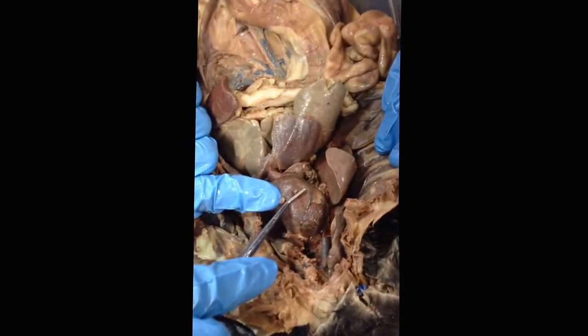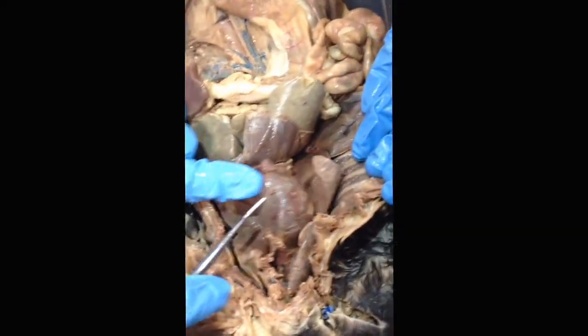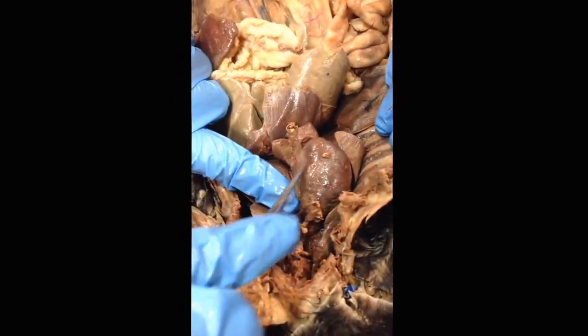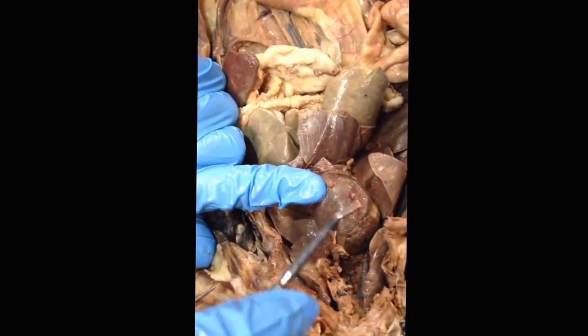Again, the best way I can give advice on this one is to look at from the perspective of the cat. So what Stephen has there is the left ventricle, and the right ventricle is on the other side, and it's just the bottom part of the heart there.